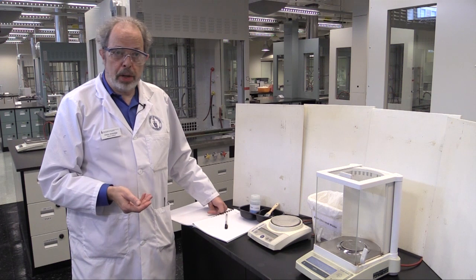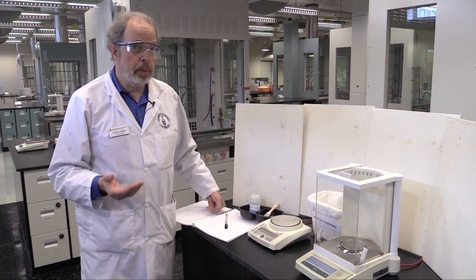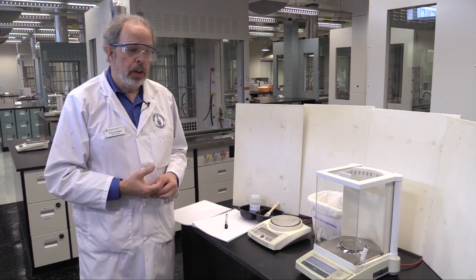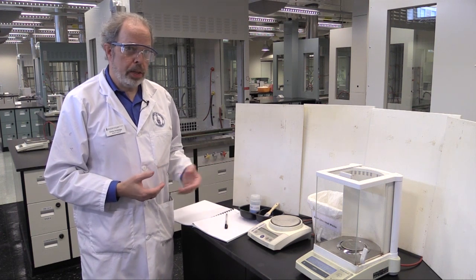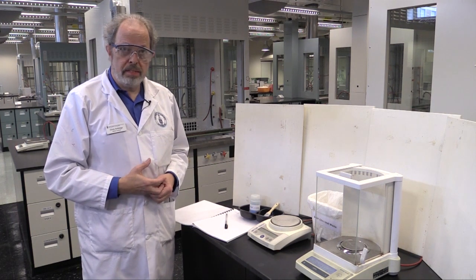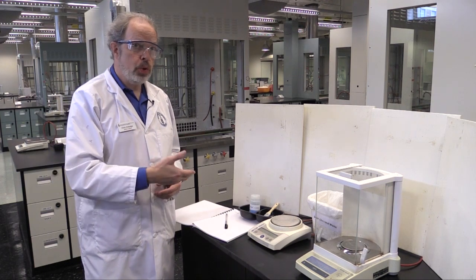Whether you are synthesizing a chemical or analyzing how much of a chemical is in your analyte, you will need to know how much you've got. If it's a solid, you'll be using a balance. This video is to tell you how to use a balance.